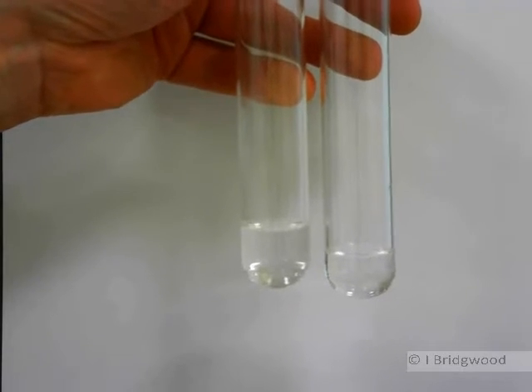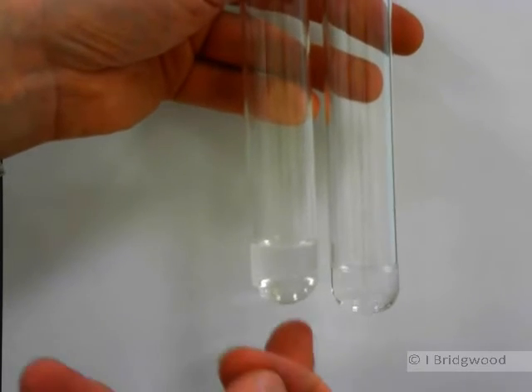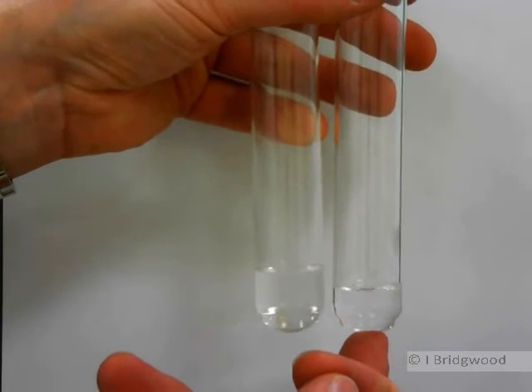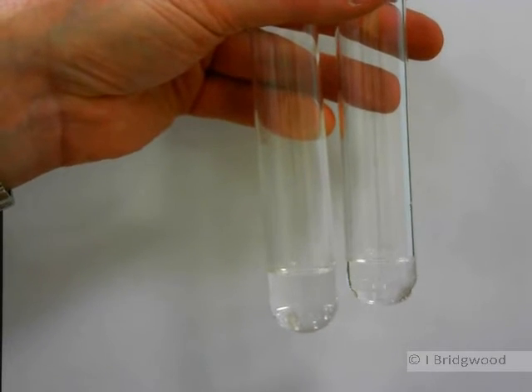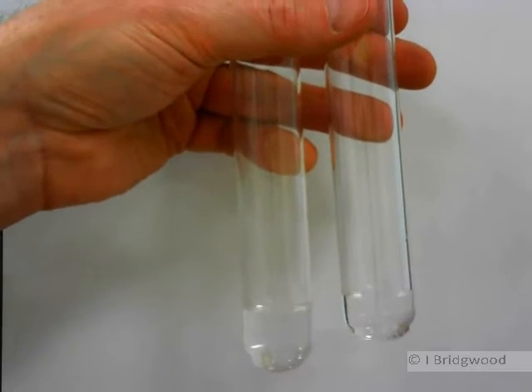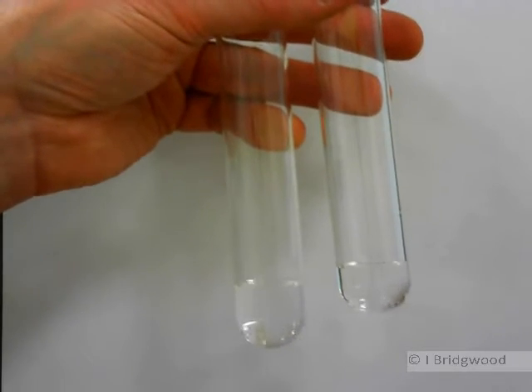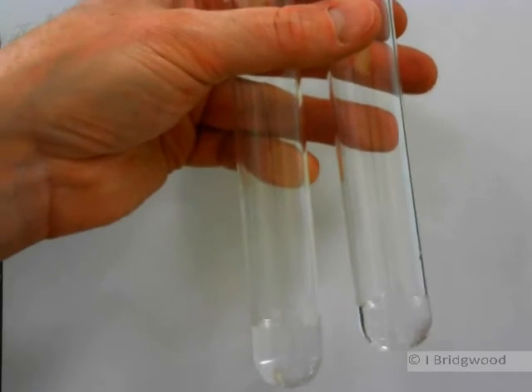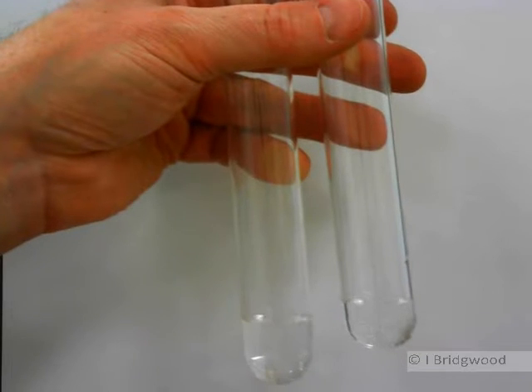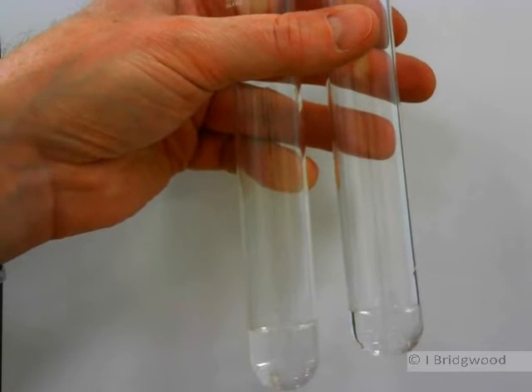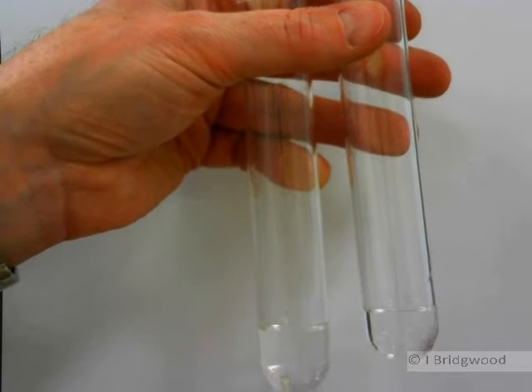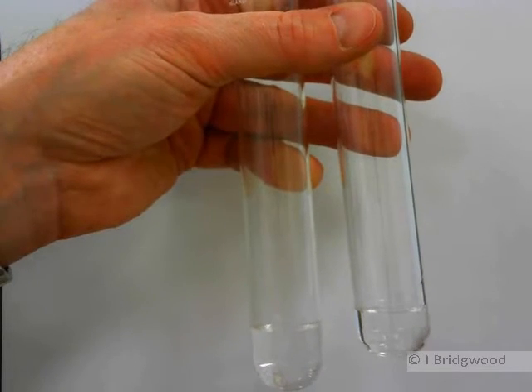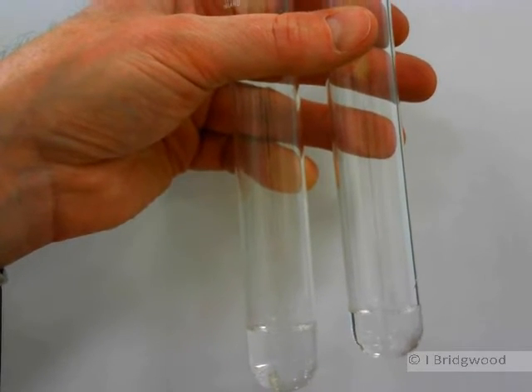Two colorless liquids, once again. We have water here and an alcohol, hexane-1-ol. So this water, extensively hydrogen bonded, the hexane-1-ol is going to be a mixture. We're going to have some hydrogen bonding between the OH groups, but we do have a relatively long chain, a six-carbon chain alkyl group there, which will tend to be van der Waals forces.